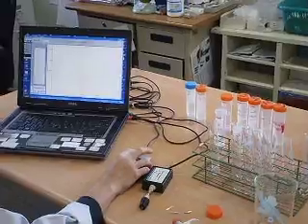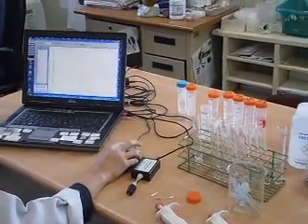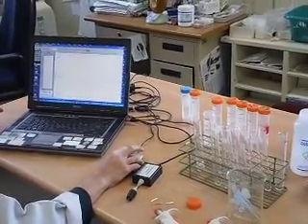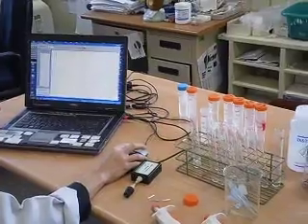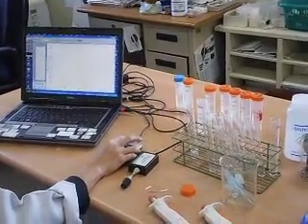This is where I stop the reaction, I remove it out, and pressure starts to drop. So I'm going to measure the gradient here. I'm going to show you how you measure the gradient using linear regression. So I'm going to start the next experiment now. Same thing that I'm going to do.